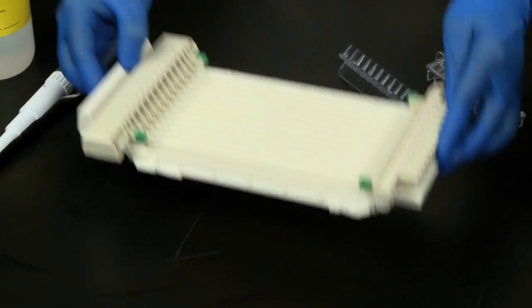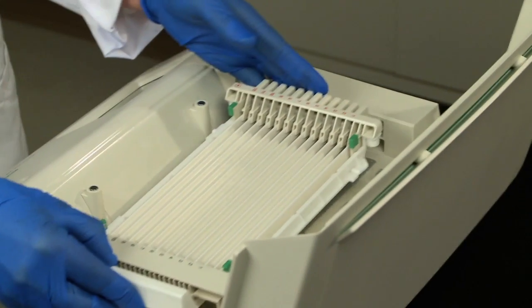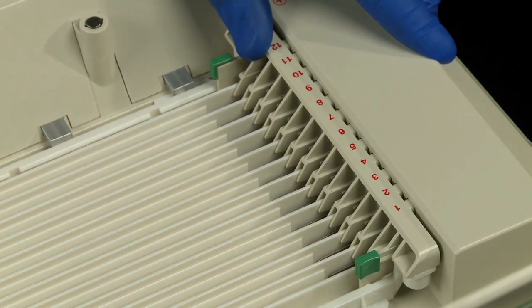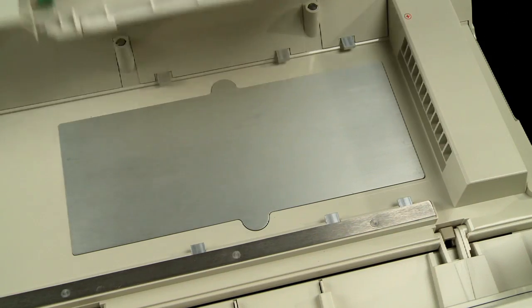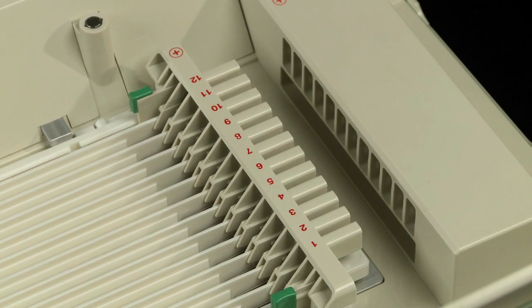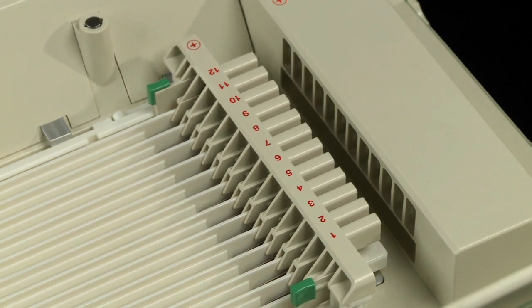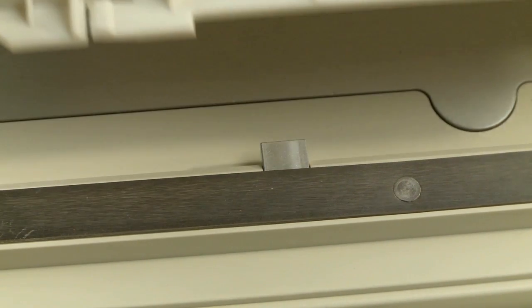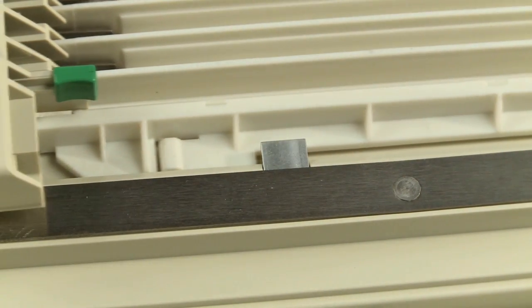Once the tray and strips are assembled, place the tray on the platform of the instrument and insert the positive electrodes into the slots on the instrument. Please note that the trays should be placed into the instrument according to the guides on the sides. The electrodes should be pressed into the instrument until a click is heard. Press the tray into the instrument until the stop on the tray is reached.